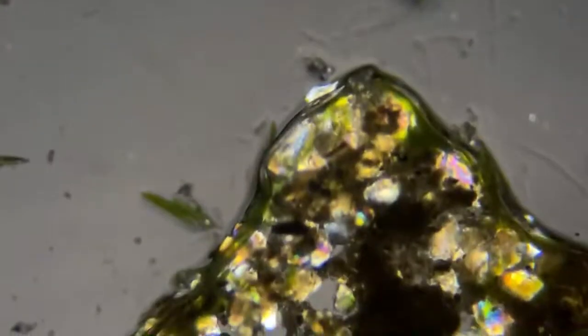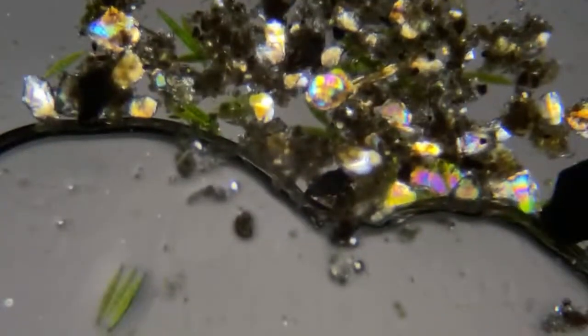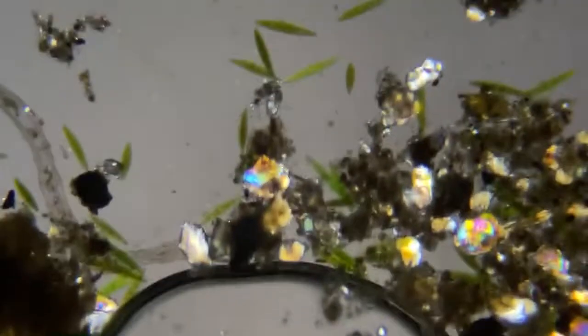And I think this is the boundary. This must be a bubble. Like this is the edge of the stage right here. See, this right here is water. From here up is water. This is dry. And this is water.